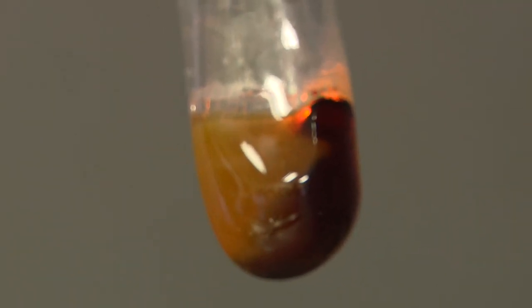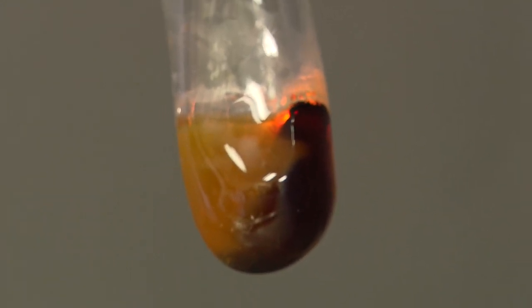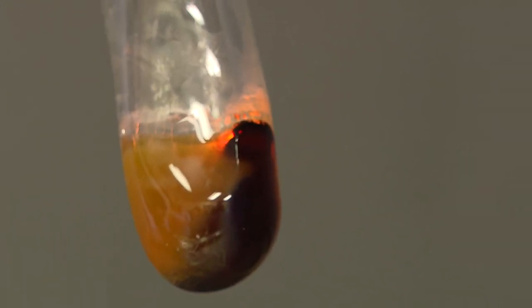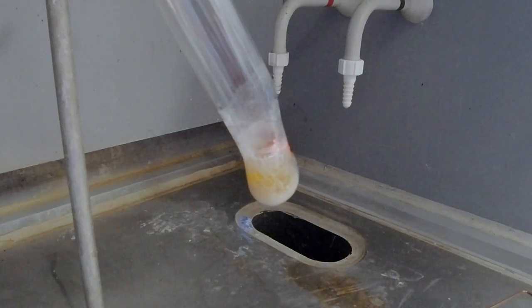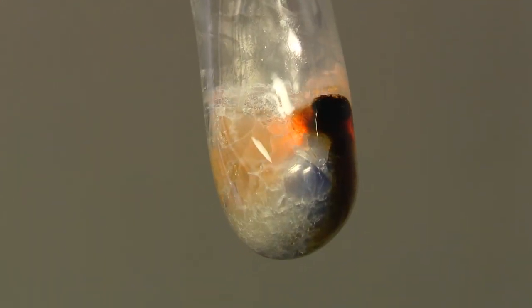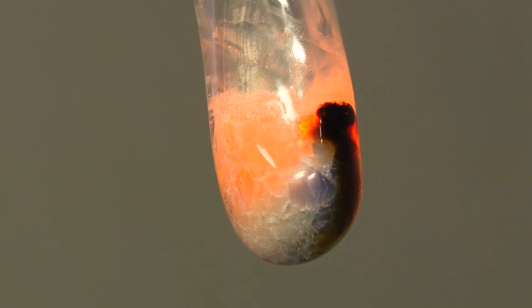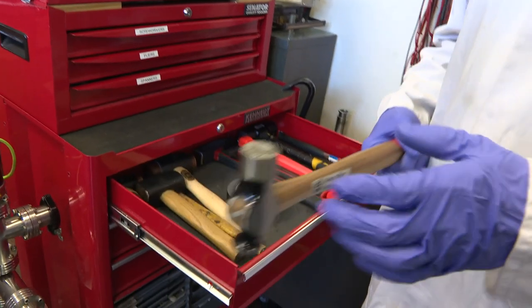Once the sodium had appeared to dissolve, we could see that there was a bluish color on one side of the test tube. We hadn't mixed it very well and Neil wasn't very enthusiastic about trying to stir it. So we left it. Once it had cooled, we needed to get it out. And as you might have guessed, Neil chose a hammer.